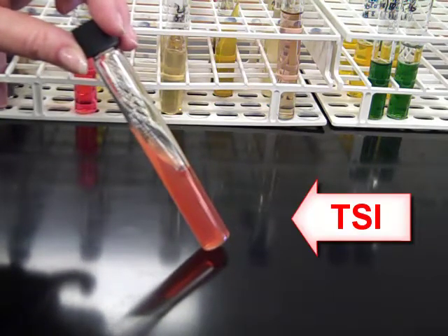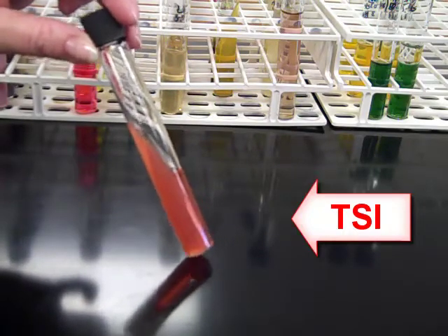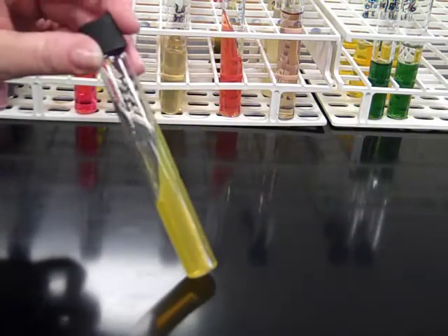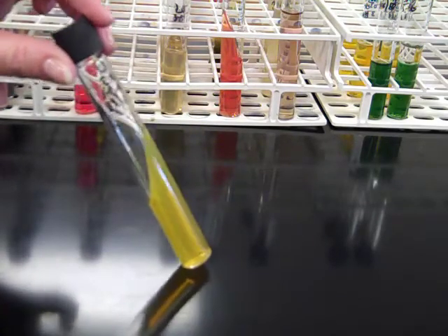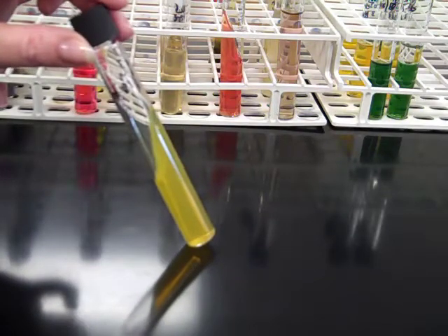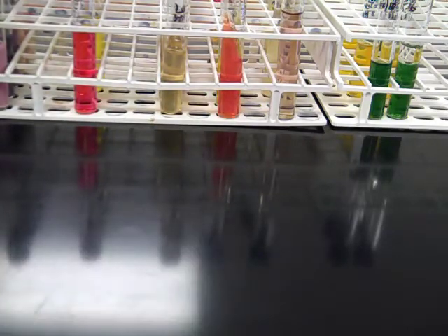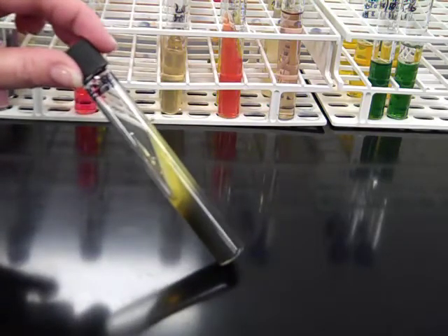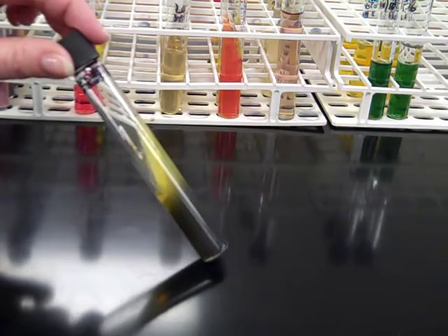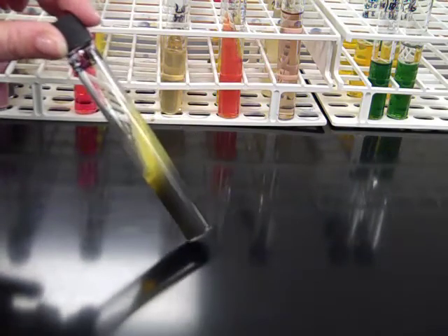We are testing not only for sugar fermentation, but also for the presence of hydrogen sulfide, utilizing the iron in TSI. A possible result for TSI is that the entire tube turns yellow. If the entire tube turns yellow, that's an indication that all 3 sugars were fermented. Along with all 3 sugar fermentation, a purely yellow tube, you can also have a positive result for hydrogen sulfide. Just like in the motility media, the hydrogen sulfide appears as a blackish precipitate at the bottom of the tube.